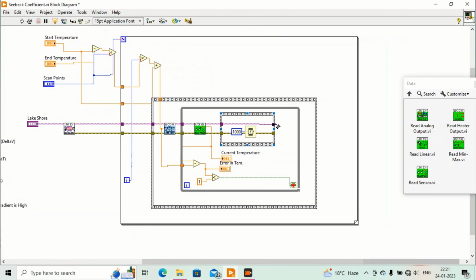In this process we minimize error in temperature between set and actual temperature, and it should always be less than 1 Kelvin, or you can fix according to sensitivity of your instrument or sensitivity of your measurement, what you need. And this section is for temperature setting.